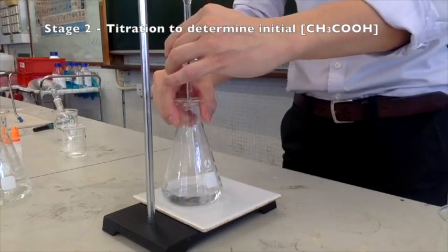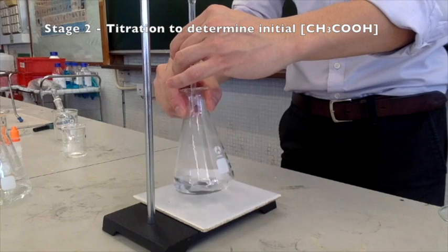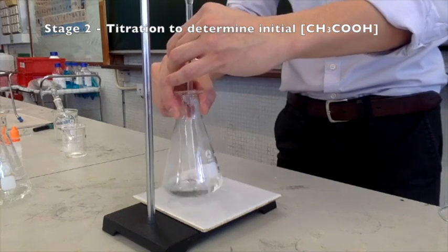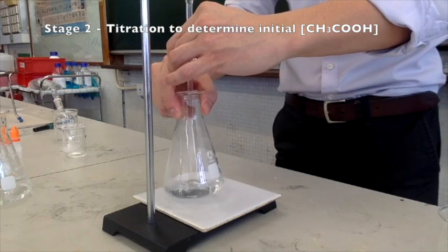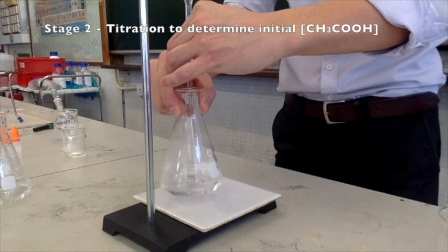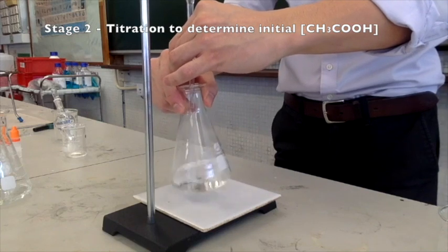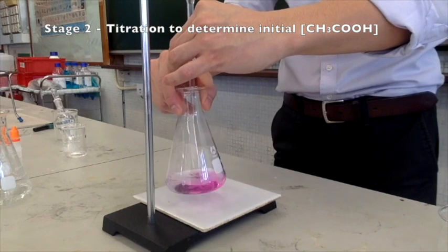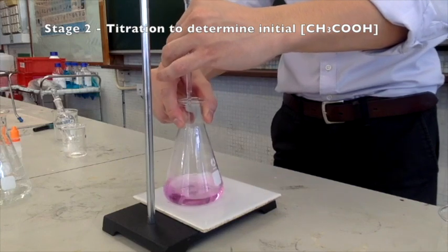So once you see a relatively large area of pink in the content of the conical flask, it would be best if you slow it down. Now you should expect to see the endpoint gives you a pink color. Alright, so now it hits the endpoint.